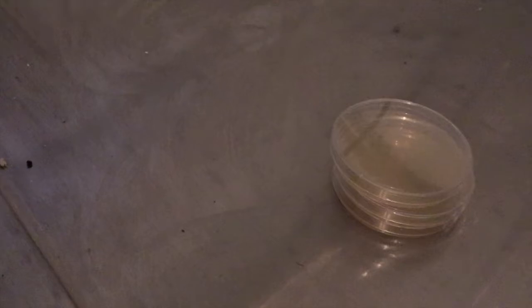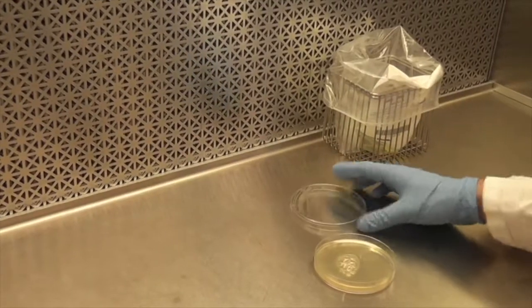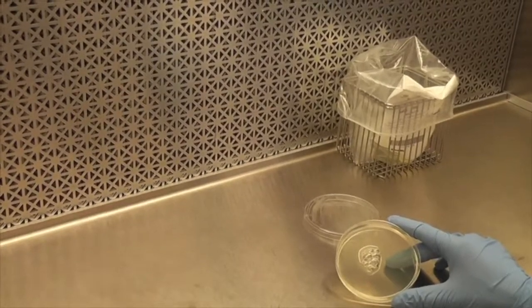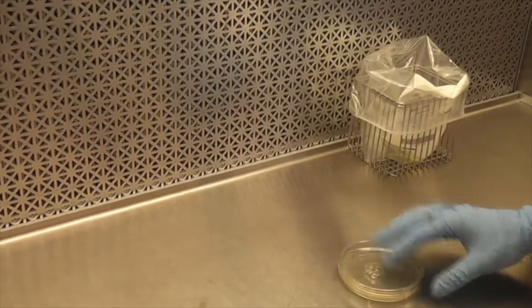In general, avoid placing your hands over the work surface. Plates with excessive bubbles that may disrupt uniform bacterial growth are not usable and should be discarded.